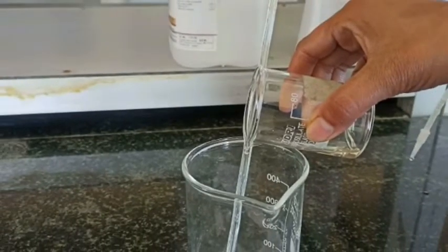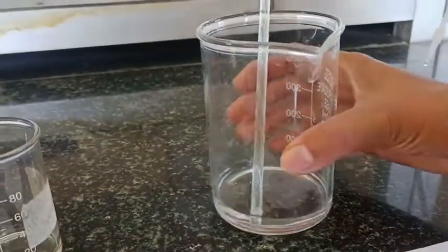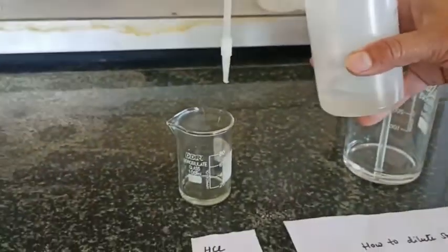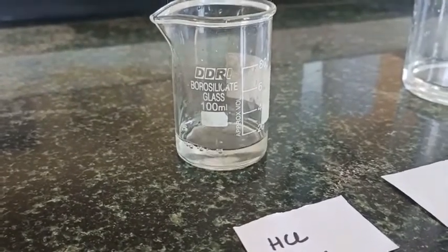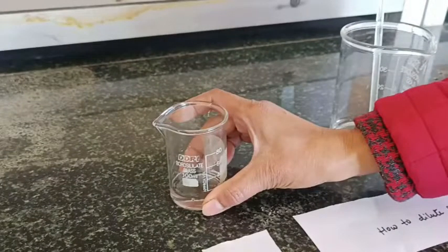This is the correct way to dilute strong acids. It is a very exothermic reaction, and adding water to the acid instead can sometimes cause accidents in the laboratory. So remember: we are adding acid to the water, not water to the acid. Please follow this important instruction.